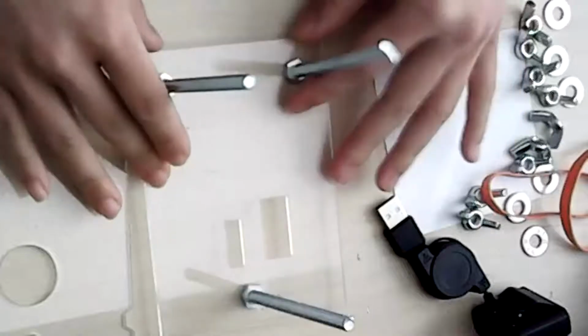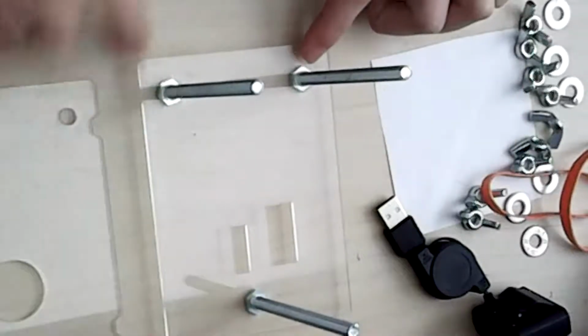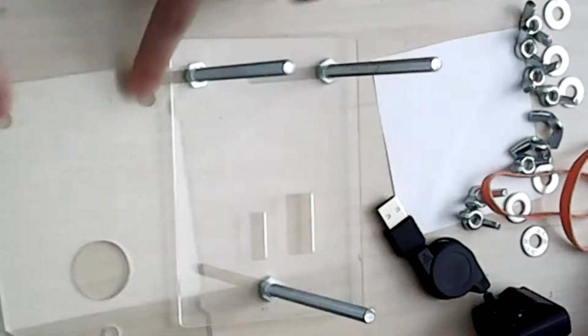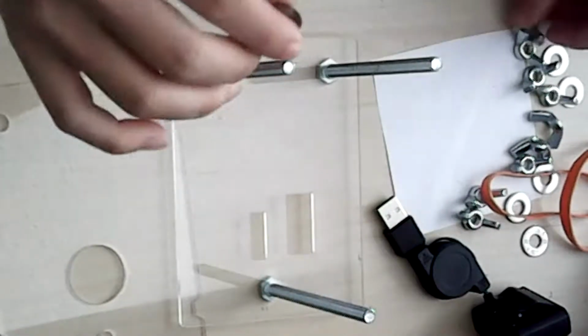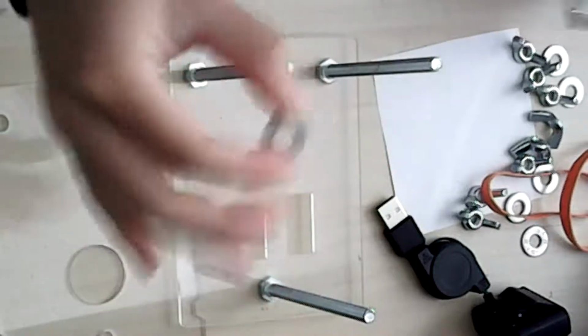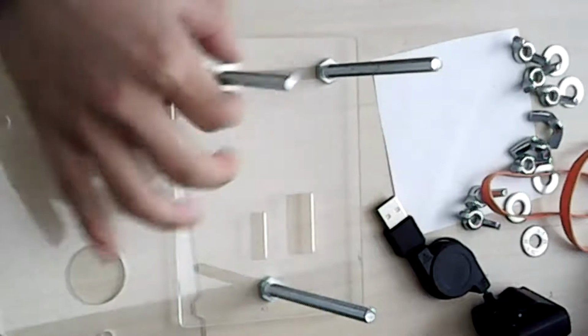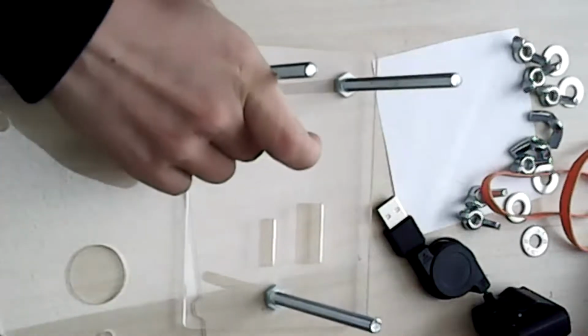Cool. So now that we've put all these through the holes on the side, there's 3 holes. The 3 holes match the 3 holes on the top one, because you pretty much just stack them on top of each other. The next thing to do is to screw them in with the washer. Make sure to put the washer in first, and then do the wing nuts. The first time I did it, I forgot to put the washer in, so I had to take it all out. So don't do that.